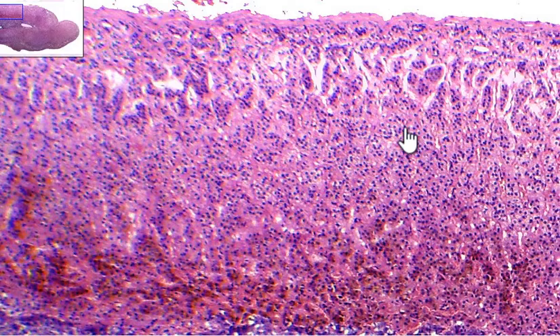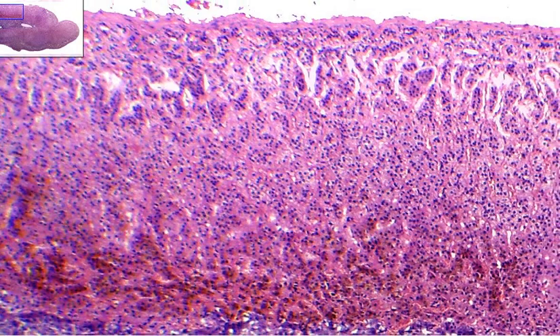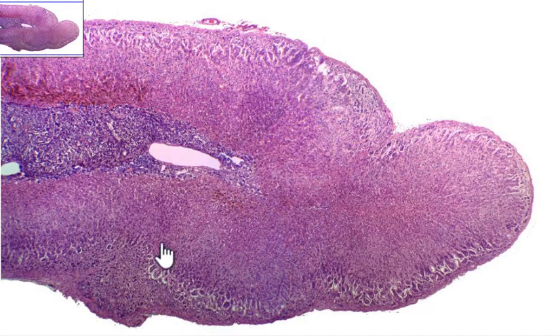So we actually have three different zonae all in the cortex here. We have the deepest layer down here called the Zona Reticularis, then the middle zona called the Zona Fasciculata, then this most superficial layer called the Zona Glomerulosa. So if you zoom back out, you can see the whole thing here.